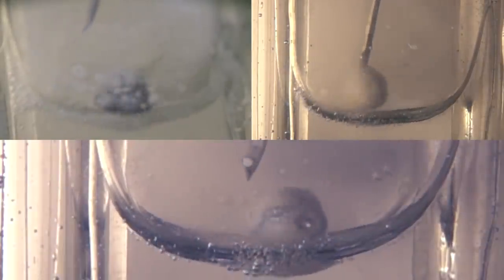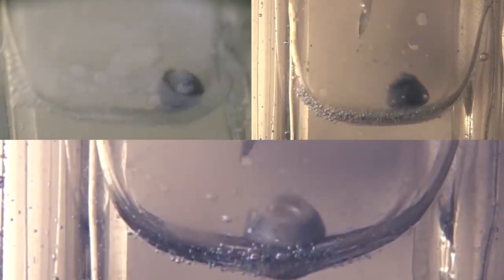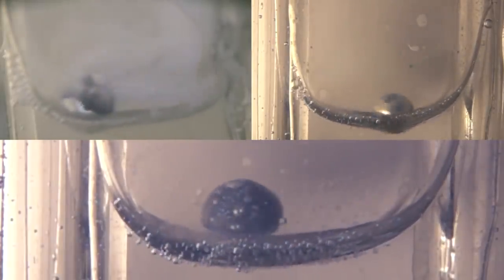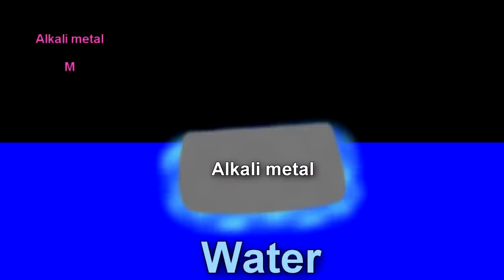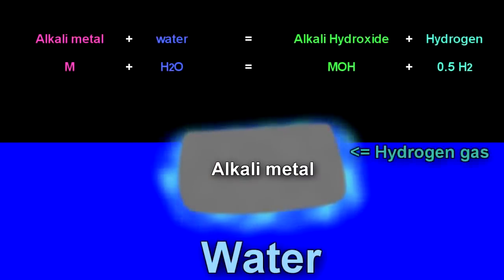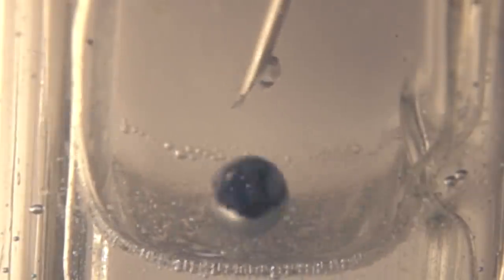So the alkali metal is added to the water, at which point it goes blue. And then it goes on. What? It goes blue? Yep. It goes as blue as it comes. And it does it again and again and again. There's just this blue skin that appears on the metal. But after that, it's just the alkali metal plus water gives alkali hydroxide plus hydrogen, right? No.